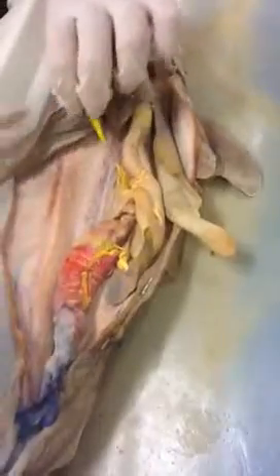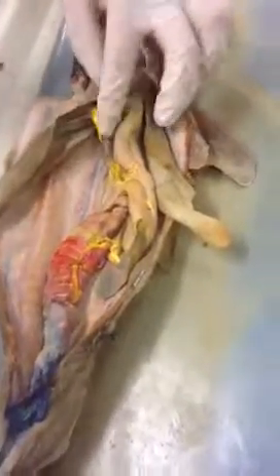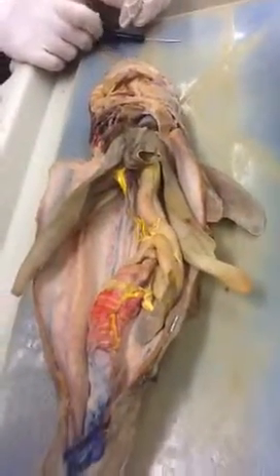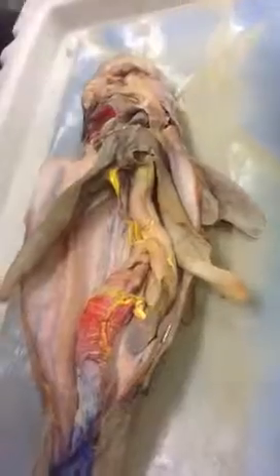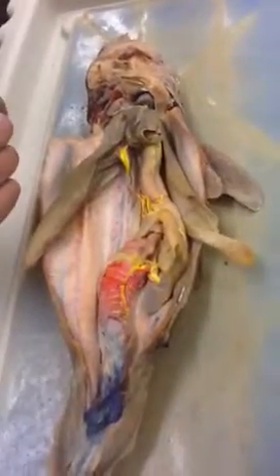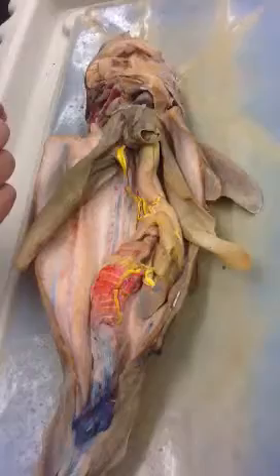And then from your liver, your portal vein drains into capillaries. The capillaries drain into the hepatic veins, which are going to be blue, which you can't really see, but those will drain into hepatic sinuses, which then go to your sinus venosus, I want to say, maybe right here. So it'll drain up. So it's like that, right? Yeah, your hepatic veins would hook up. So actually it might be your sinus first and then your vein, I don't know.